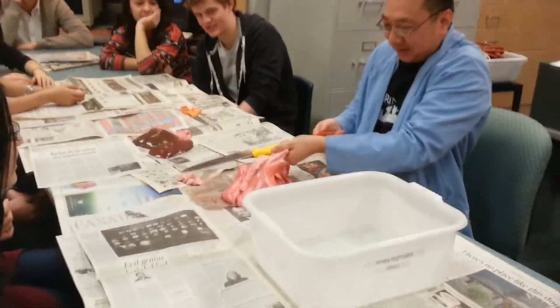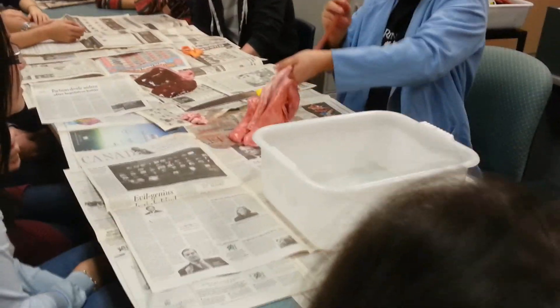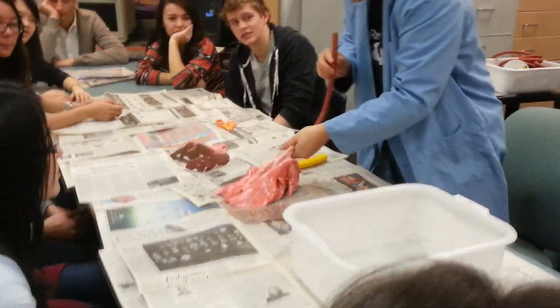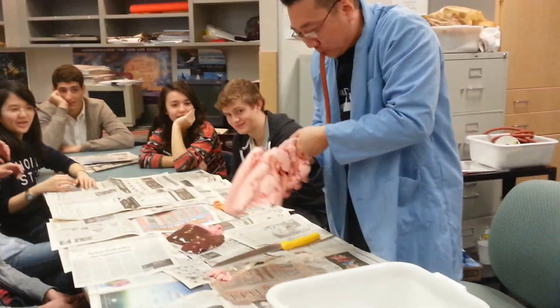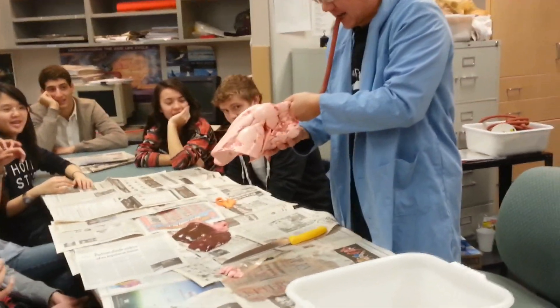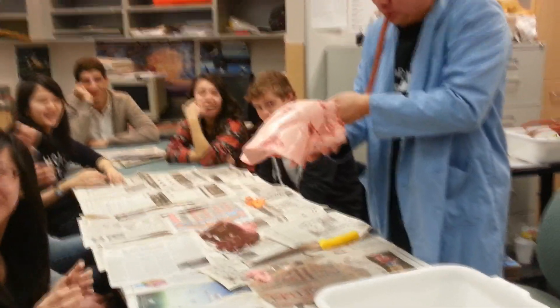I don't want to get dirty, you know. Okay, here we go. Ready? Okay. Who else wants this? Woah! Let's get that on video, guys!